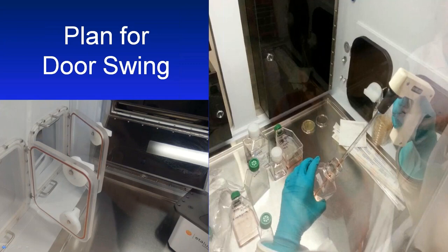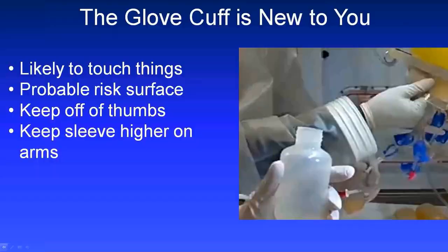You might consider using a small tray to contain a lot of small items if you're going to anticipate that you're going to need to move them in order to do something like open up a door. So that's just one tip that might help you avoid frustration from having to move things around frequently during your process.